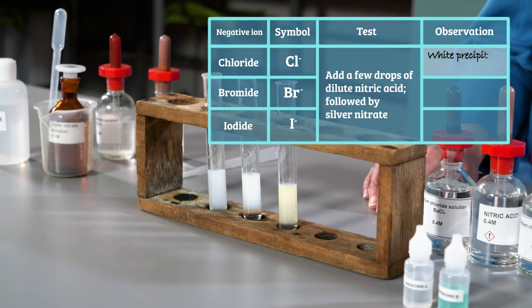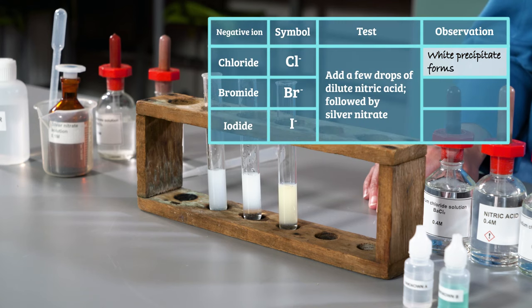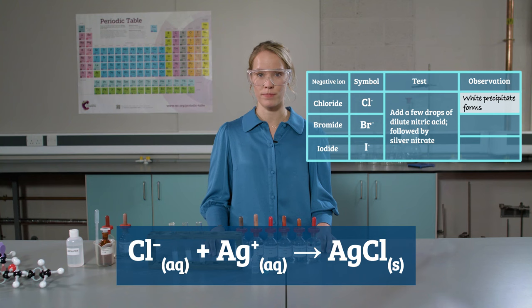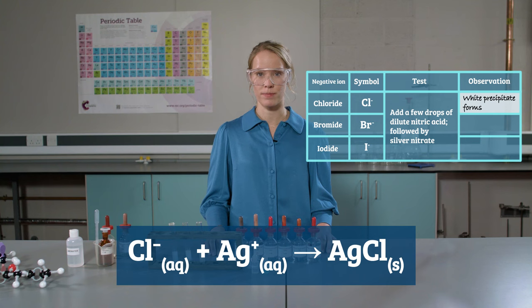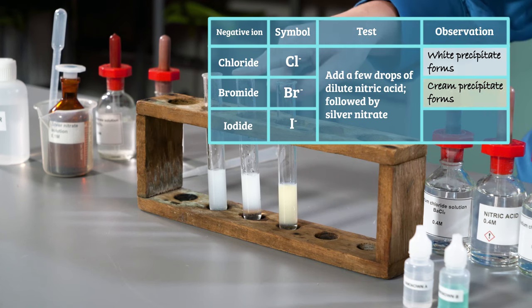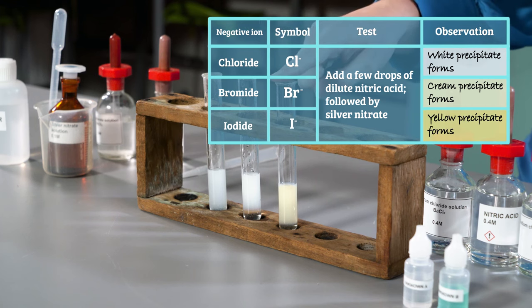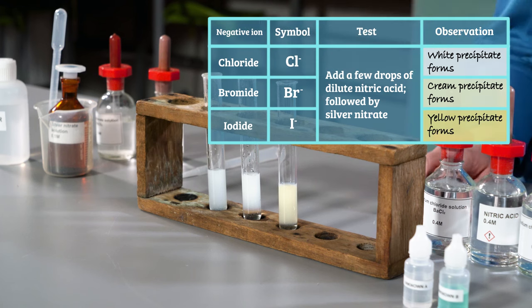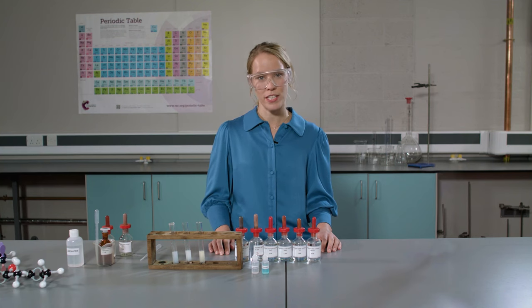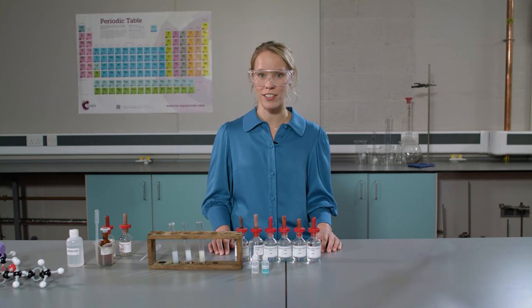If the chloride ion is present, a white precipitate of silver chloride is formed. If bromide ions are present, you get a cream precipitate, and for iodide ions it's yellow. Use the additional resources with this video to help you write word and symbol equations for these reactions.